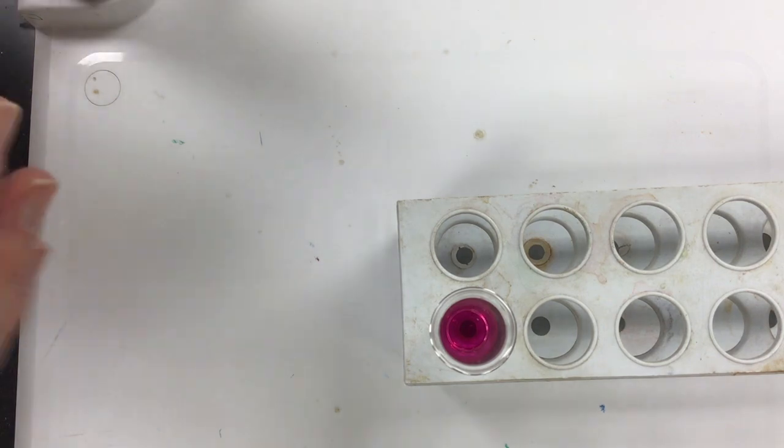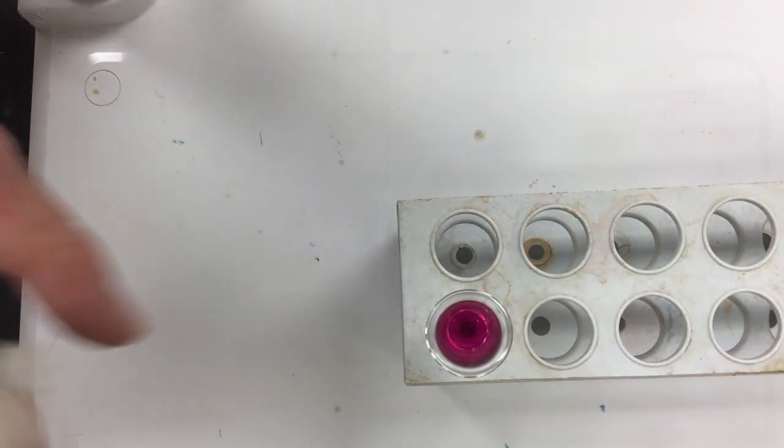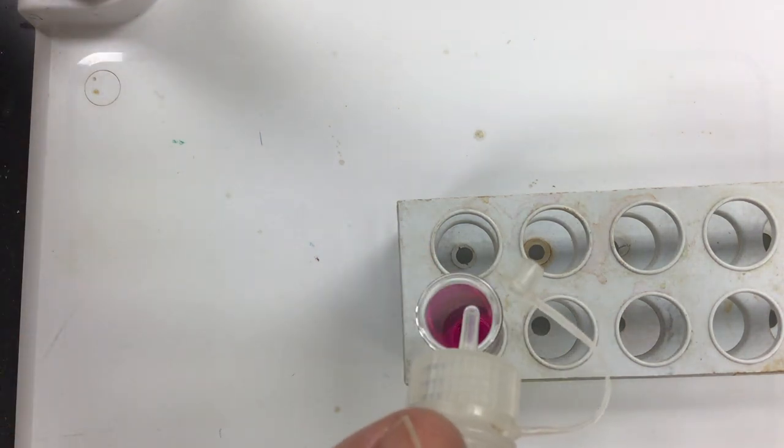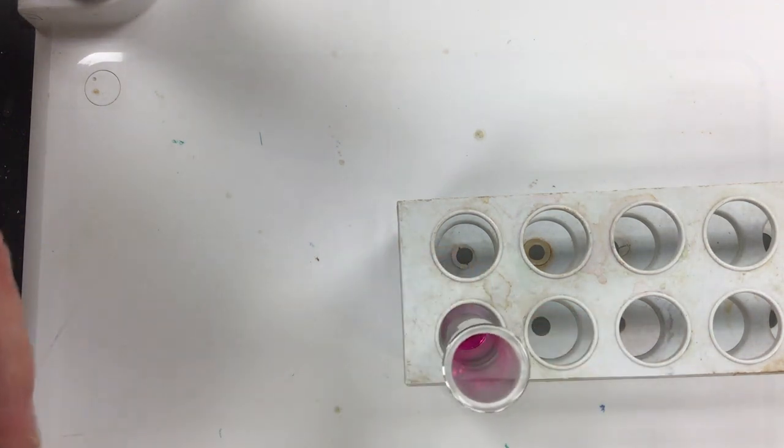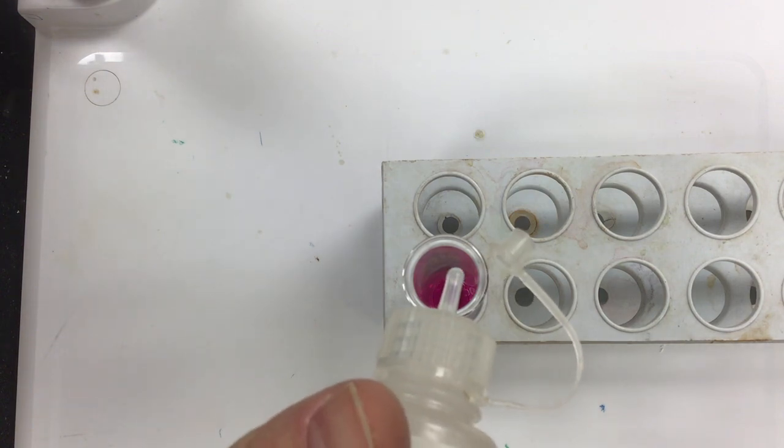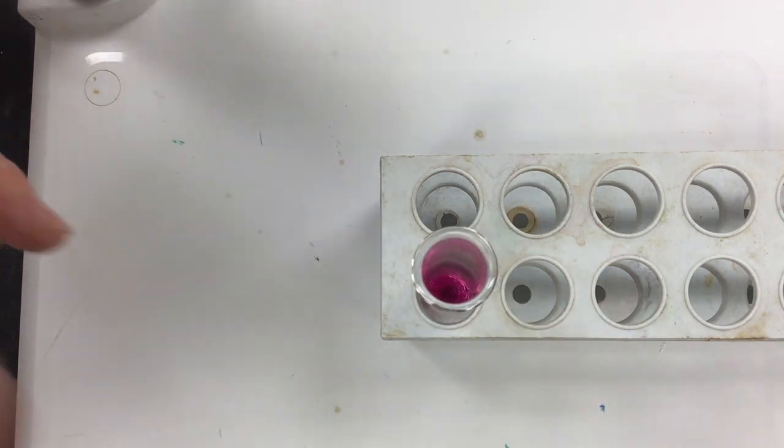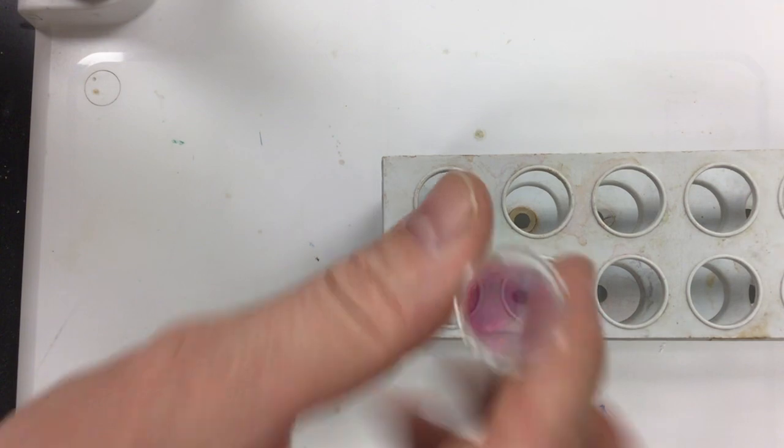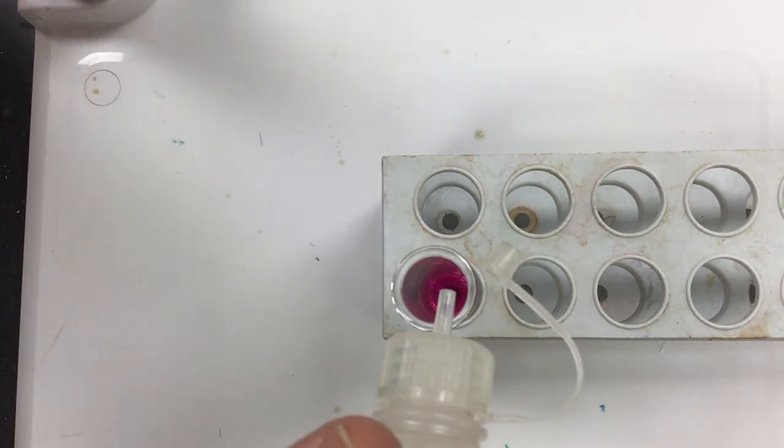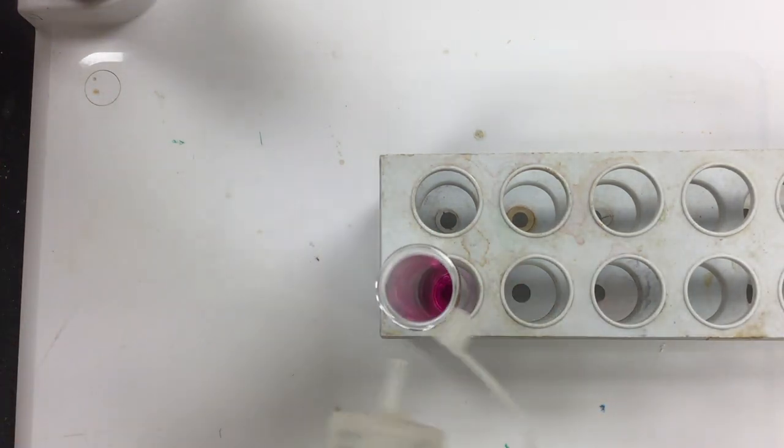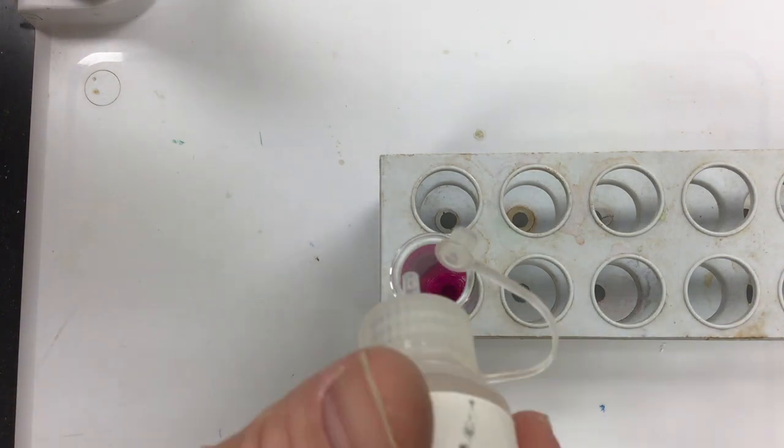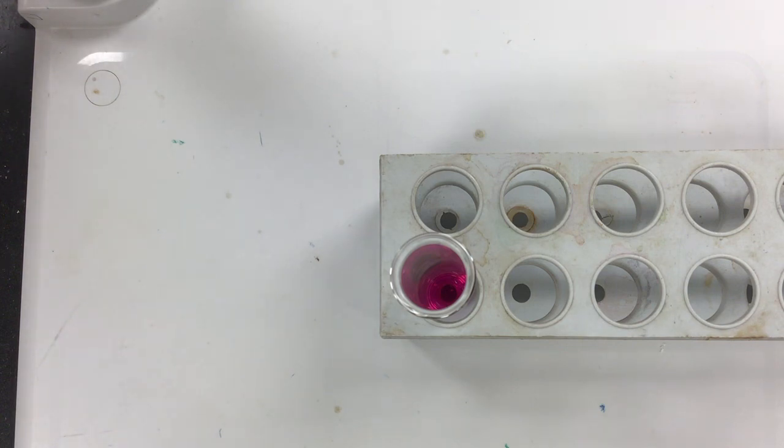So here we go, here is one drop there. I'll shake that up. One drop is not enough, still pink. Here is two drops like so. Two drops not enough. Here is three drops. Three drops still pink. Here is another one, four drops still pink after four. Here is a fifth, still pink. Here is a sixth, still pink. Seventh still pink. I clogged here, what's going on.